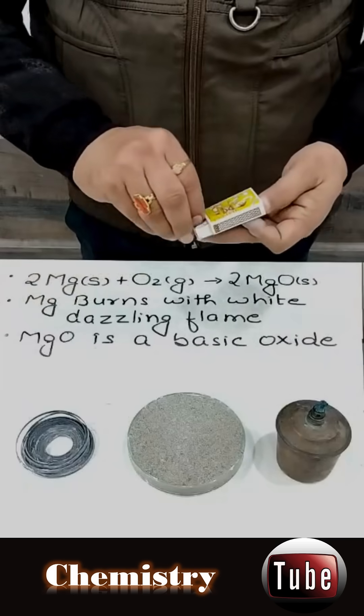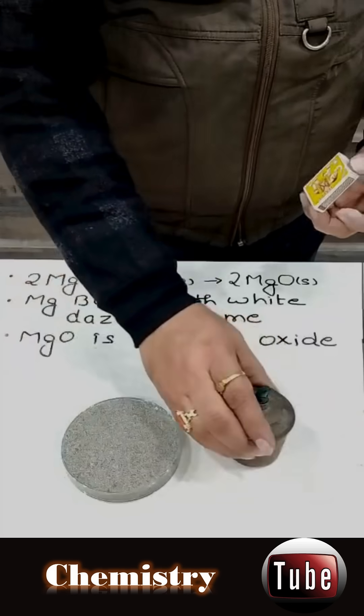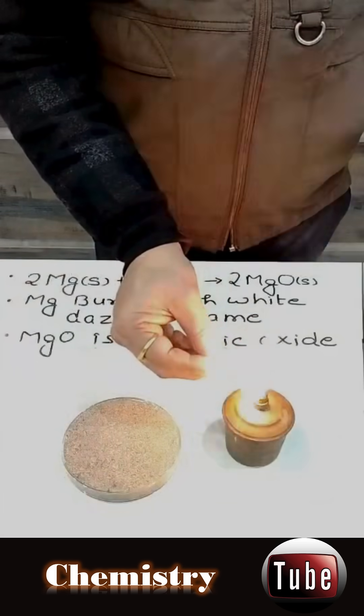Now it is time to burn this magnesium ribbon. For the sake of safety, we have taken a little bit of sand here. Let us try to burn it.